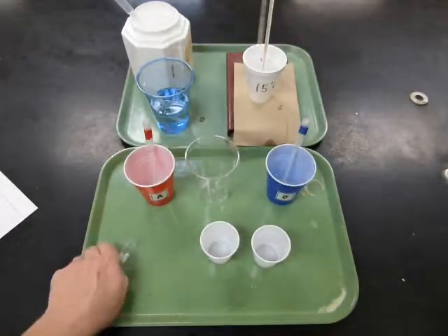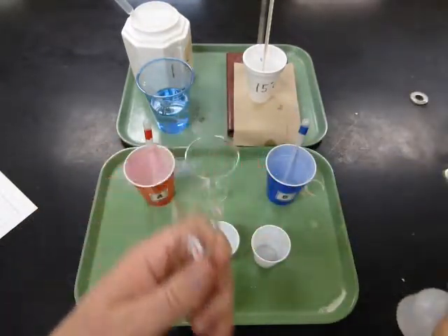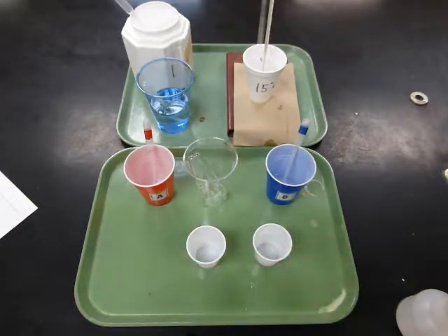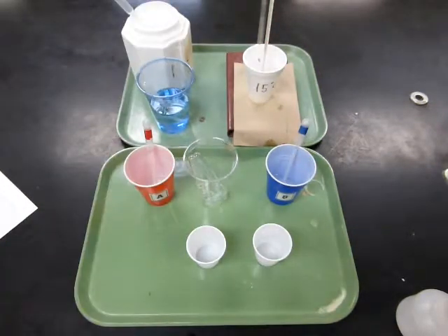When you're all done, these test tubes can get cleaned out in the sink. Use a squirt bottle, squirt some water down into each one, and then please put them back into the cup upside down in order to dry out for the next class. And then the little white cups can get thrown away. You can pour the water out of this cup too. You can get it out just by raising up the thermometer. And make sure that you wear your goggles at all times during the lab because, of course, we are working with dangerous chemicals. Let's go ahead and get started.